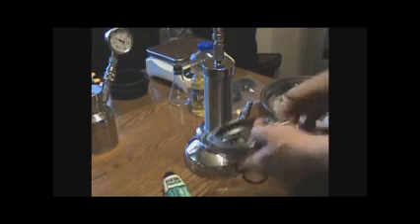Now place the column on top of the extractor tank, so you've got the column filled with lavender placed on top. Put the clamp around it — you don't need to lubricate that O-ring because it doesn't twist against any metal, it just lays flat. Tighten this up as tight as you can get it with your fingers, and now you're ready to extract.